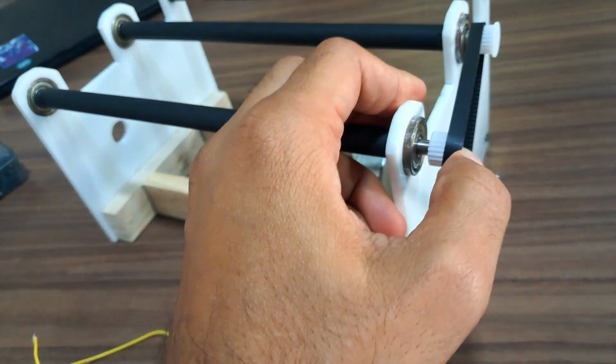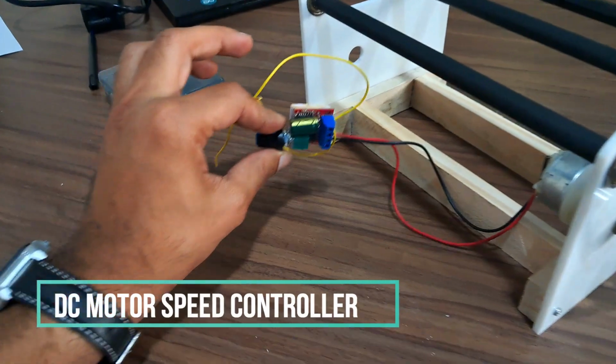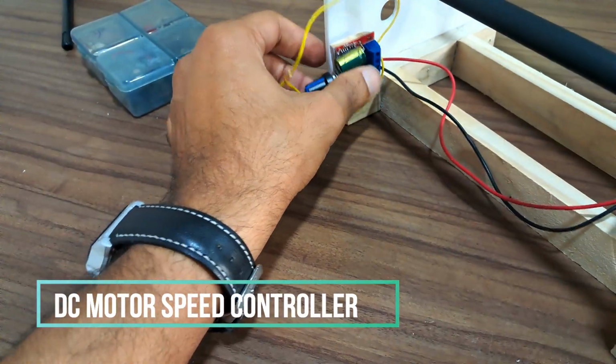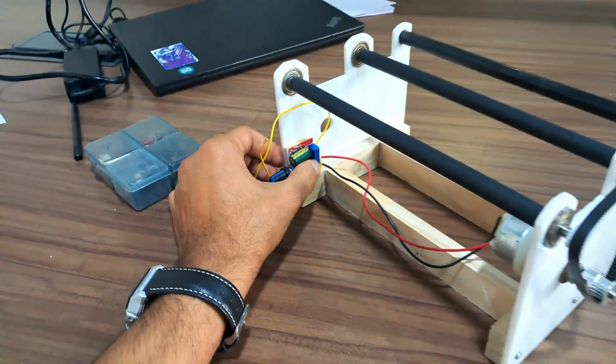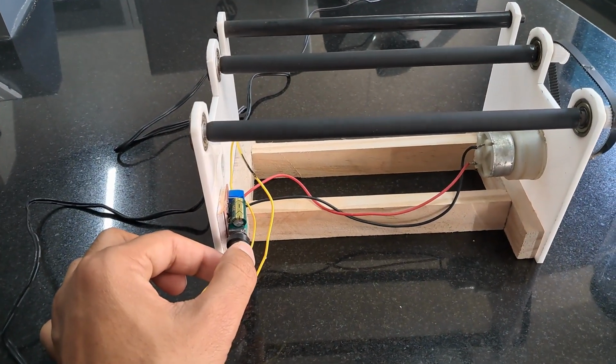So after all, I will place the motor controller. Now it's ready to work. I'm using a 12-volt adapter to run this setup.